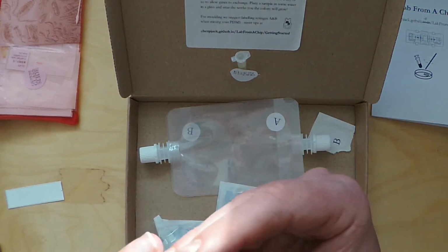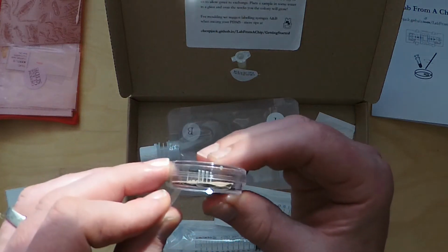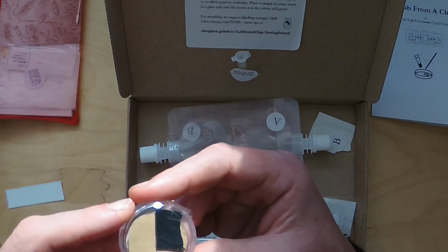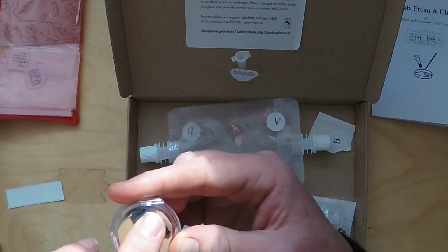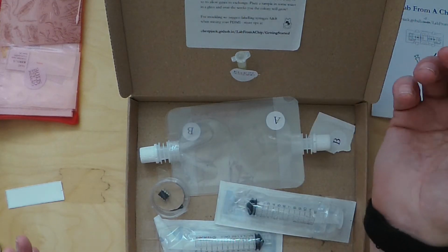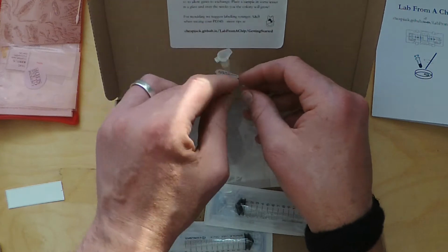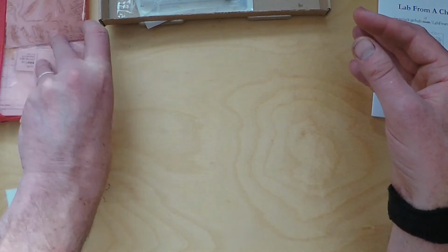I've taped it up in a way that you can easily grab the ends of the tape, and you'll be able to unwrap that and access the tiny little timer chip that we're going to make impressions from, and this lovely artifact of early rock and roll here, the vinyl record, which again we'll go through when we're making our impressions. So what I'll do now is put this box to one side, keep it in the sunlight, keep our algae happy inside, and we'll just concentrate on the Foldscope.